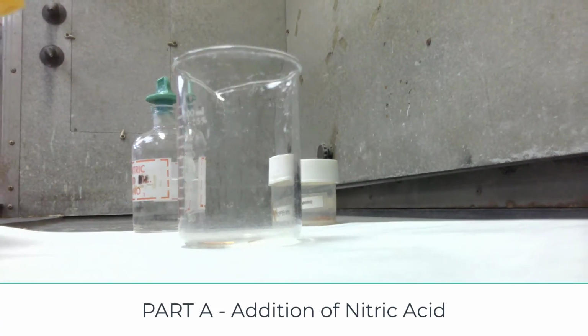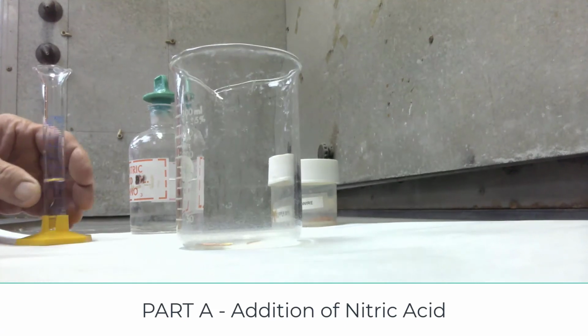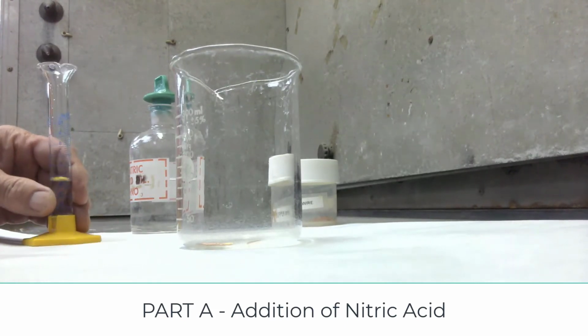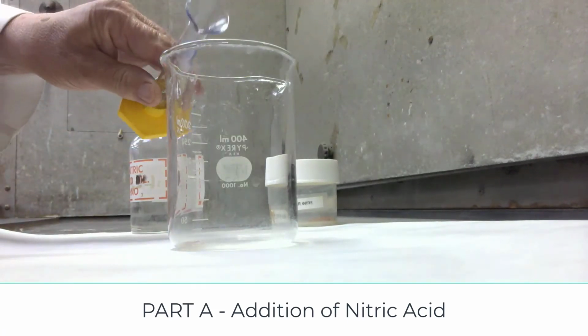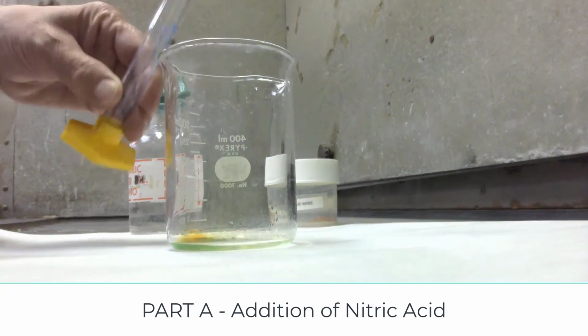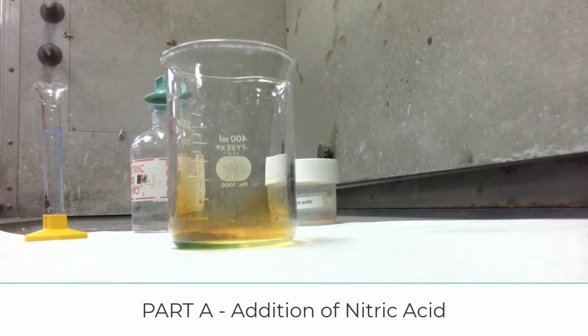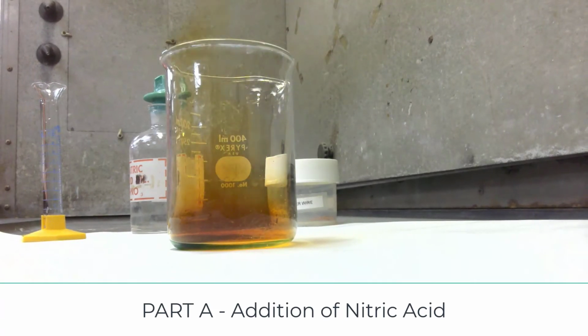Okay, the amount of nitric acid I add is not quantitative. The amount of metal I'm using is quantitative. So now I'm going to add the nitric acid to my copper. And again, you should see a reaction taking place. The brown gas is nitrogen dioxide. It is a poisonous gas, and that is why we must do this in the fume hood. And we will let this react until all the copper is dissolved.